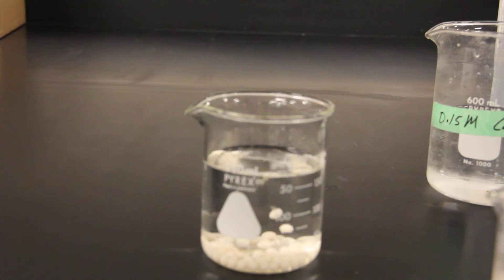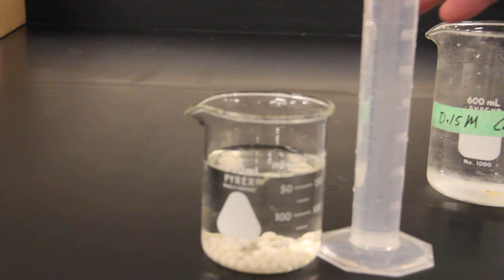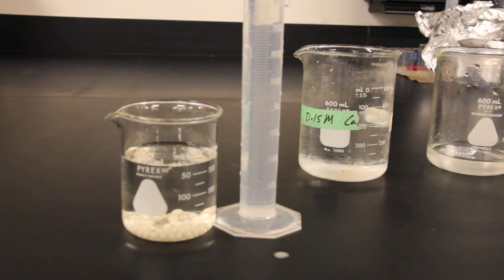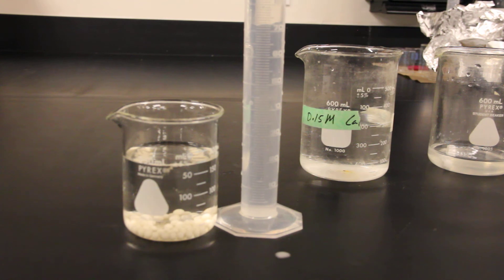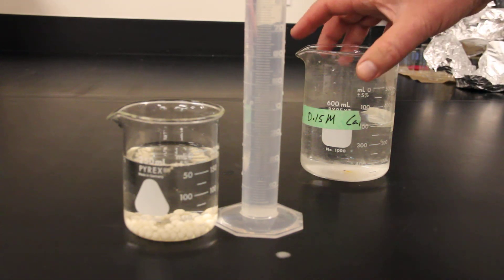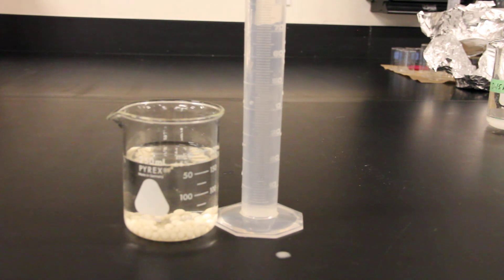Now that you've got the yeast spheres made, you've got your model organism for studying enzymes, that is the yeast contained in a sphere. Now what we can do is I have an approximately one percent solution of hydrogen peroxide. If those yeasts are alive, as they should be, I'll be able to drop one of those yeast spheres into this.